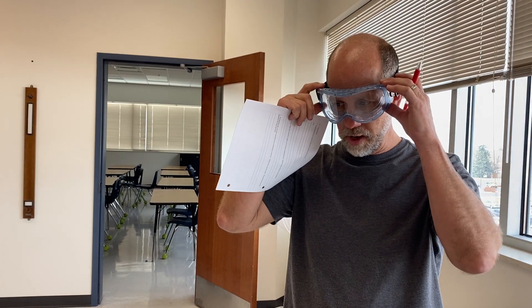Today we're going to carry out the Reaction Types Lab. If you haven't yet watched the pre-lab, be sure to do that. It explains the data that you're to be collecting as you do the lab, the outcome of the lab relative to writing up balanced equations, and it also reviews the idea of gathering information about the phases that the reactants and products exist in. If you haven't yet watched that introductory video, please do so now.